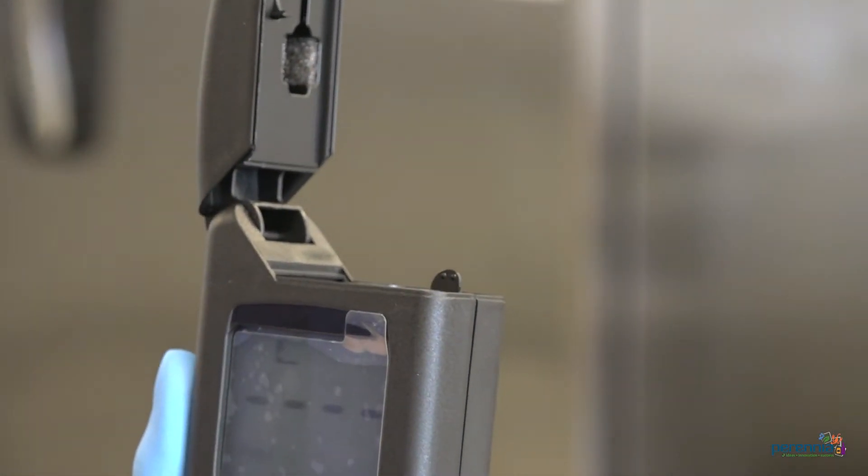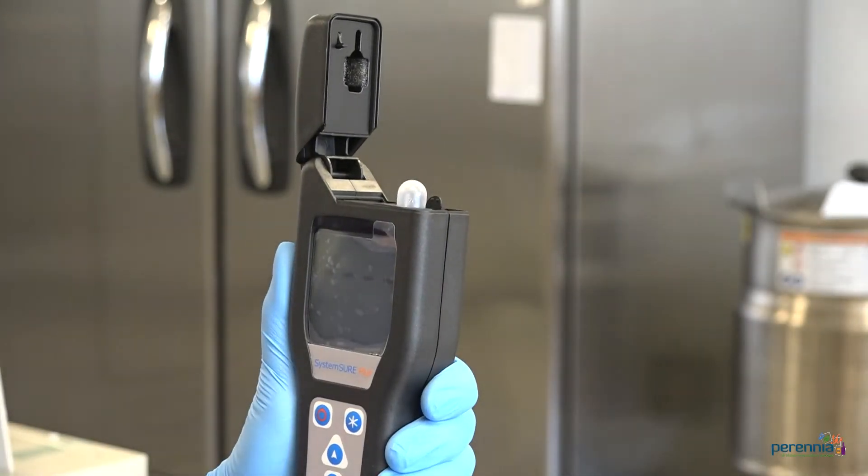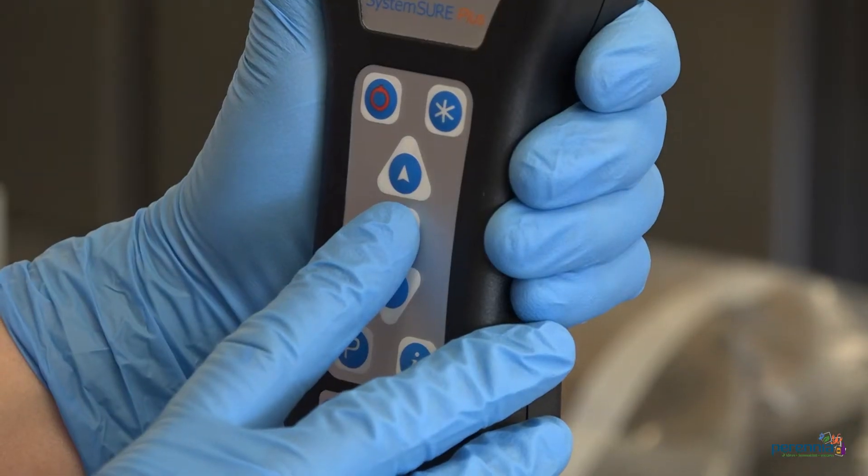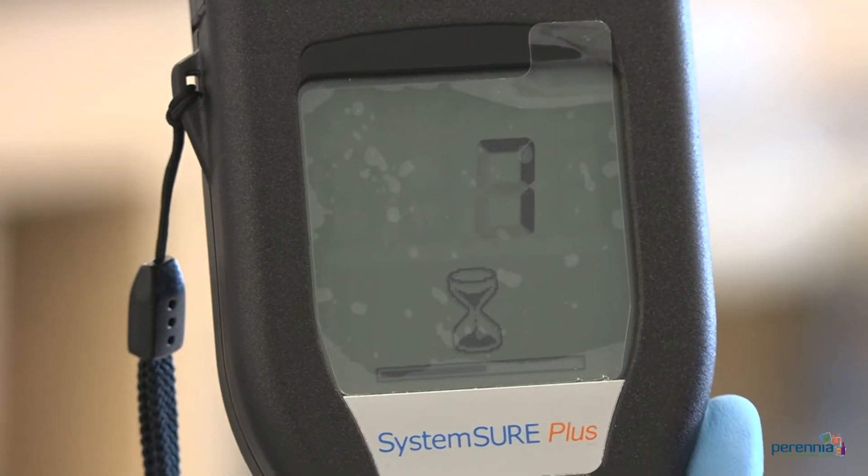Open the device and insert the positive swab. Close lid. Hold device upright and wait for reading. Results are displayed in 15 seconds.